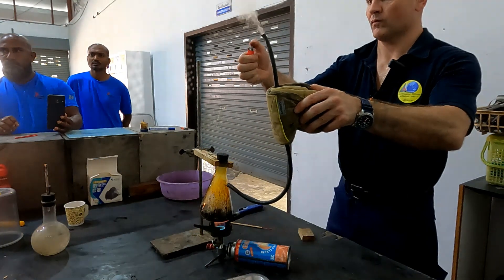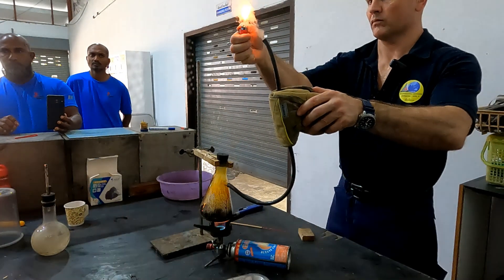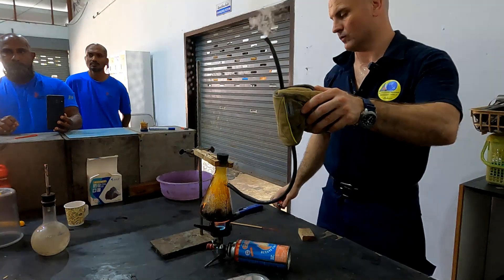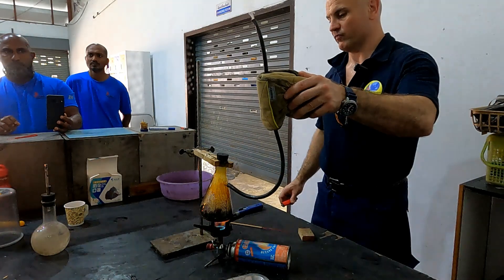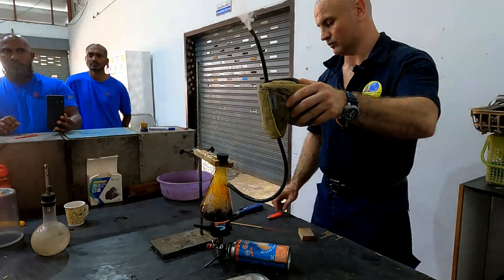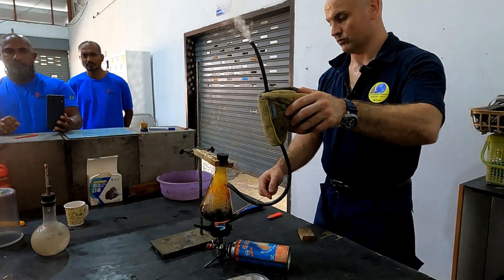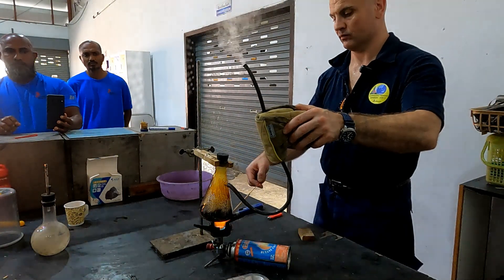It's unbelievable, isn't it? I find it fascinating. I've taught this for 20 years and everyone always says black — but I guarantee you it's white. Because that chemical process is maybe around 300 degrees Celsius. It's chemically breaking down the bonds and the volatile organic compounds are being released. The carbon is not volatile.